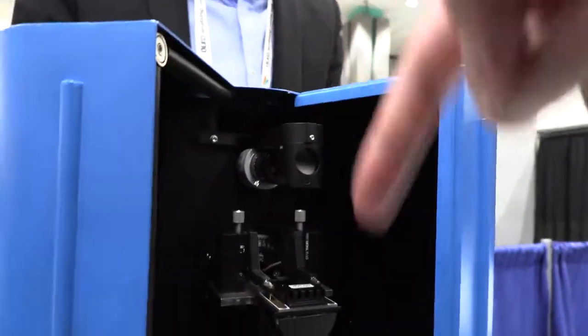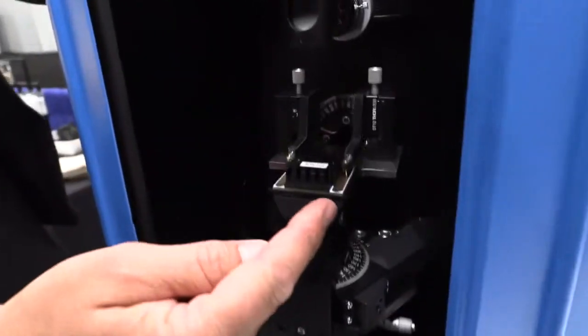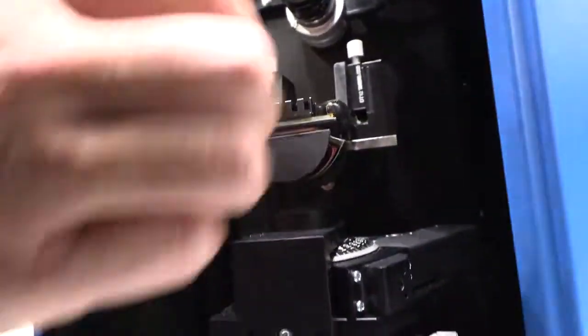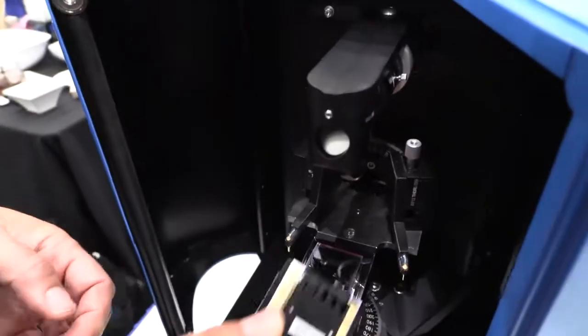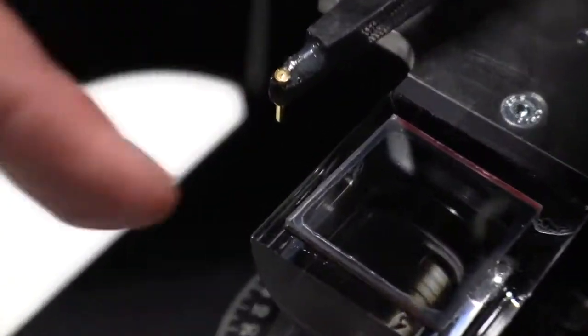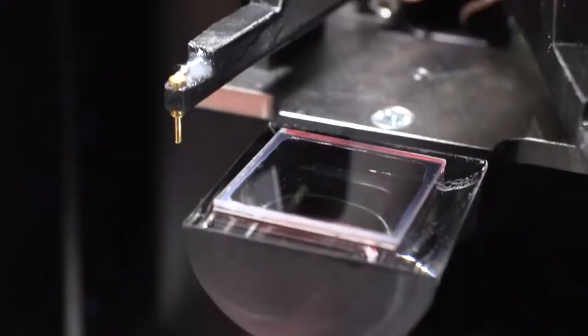So what is each part doing right here? Right here we have a sample holder stage with a macro lens. So it's holding a sample of an OLED display? It's not a complete display. Basically it's an emitter layer, a layer of an OLED. We see here there's a glass. It looks transparent, but you just saw before, if we illuminate with the blue light, then it will luminesce in green. And this transparent layer is part of an OLED pixel in the end.